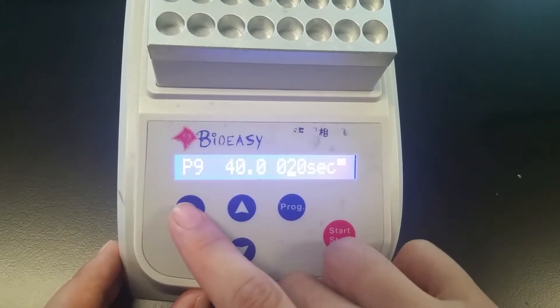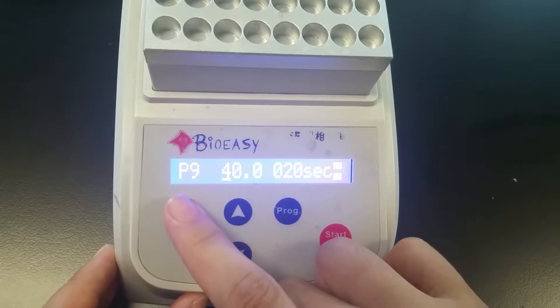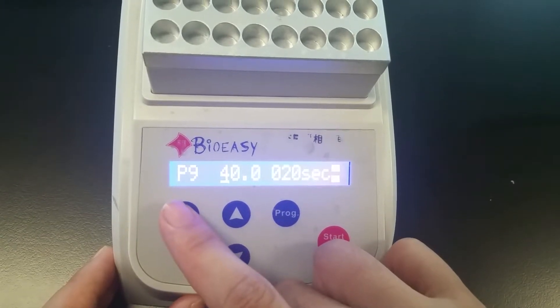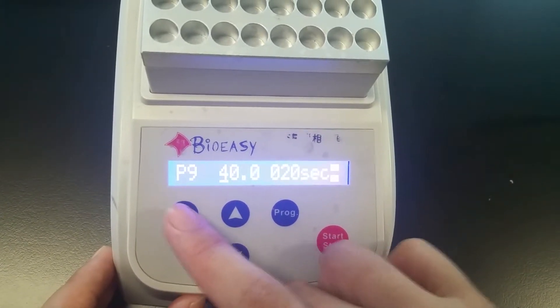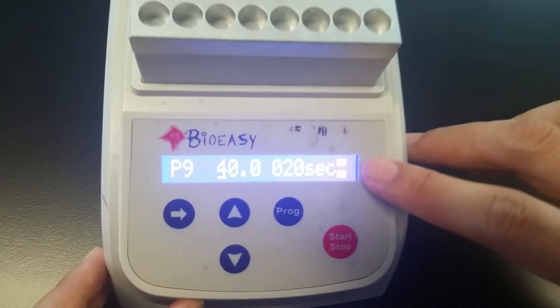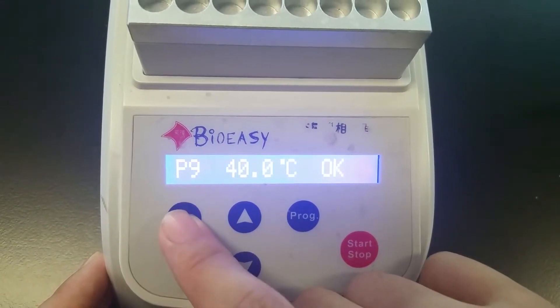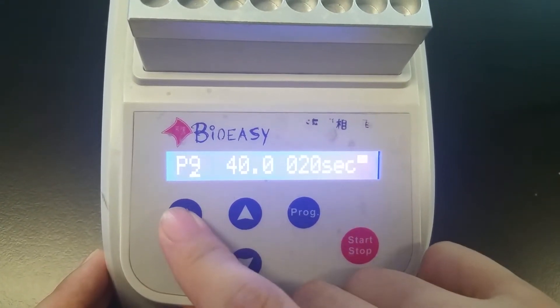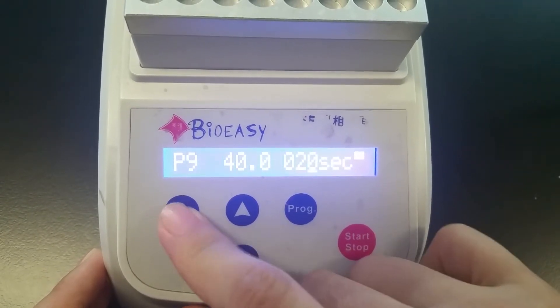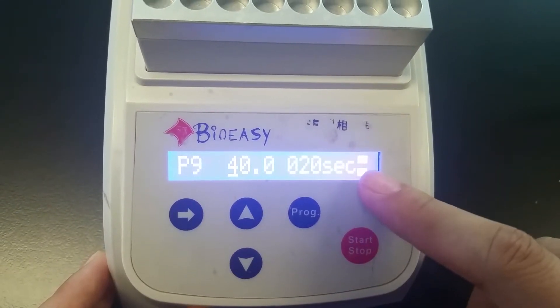And we can move the left button further to finish the first incubation temperature and time settings. So now on the right corner, it shows two squares.